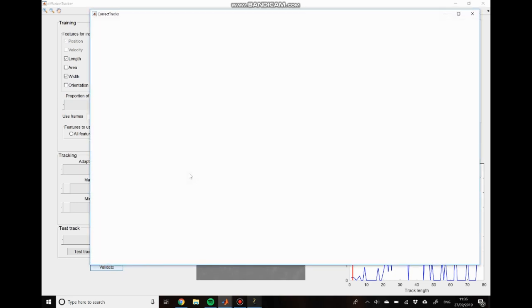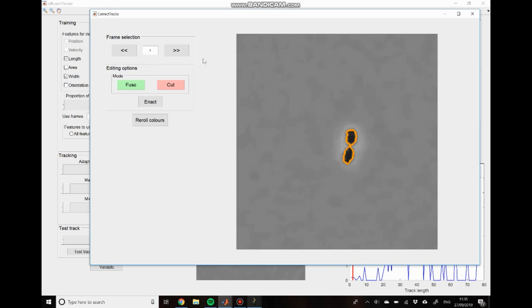And after you click this button, you should see this window appear. And this contains basically two main elements. There's the frame selection panel, which allows you to scroll through the different frames in the movie and assess how the tracking was. You can also edit it by text. And then you have these editing options, so you can have fuse or cut, these are the two different modes, and then enact, which allows you to apply the specified modification to the tracks. So I'll start off in the fusion module and we'll just scroll through this image and see where we need to fuse some tracks. Okay, so here's a good example.